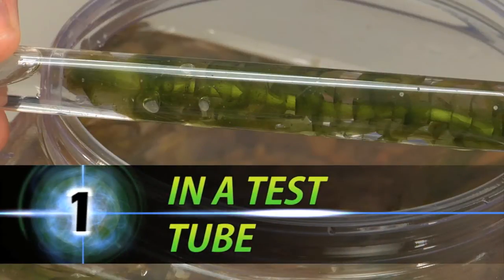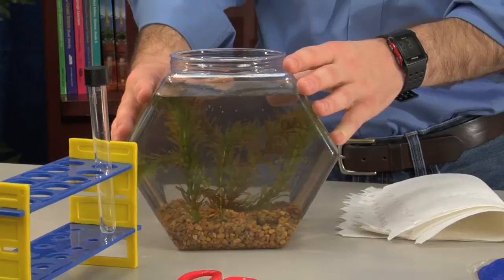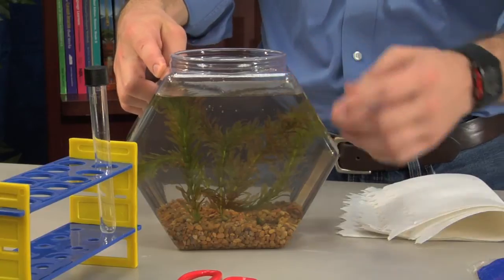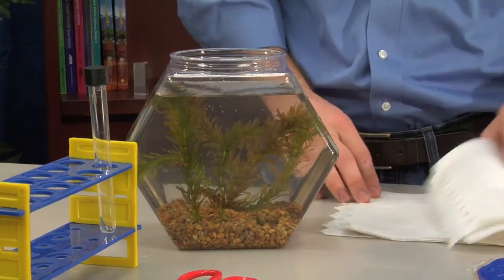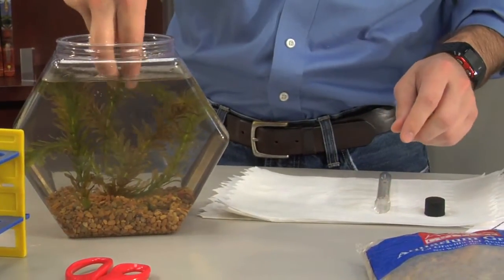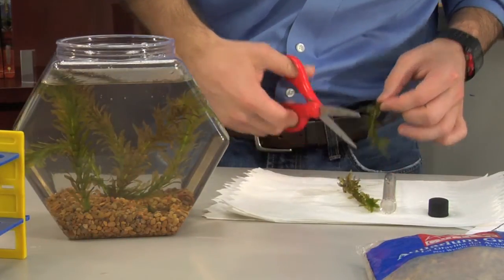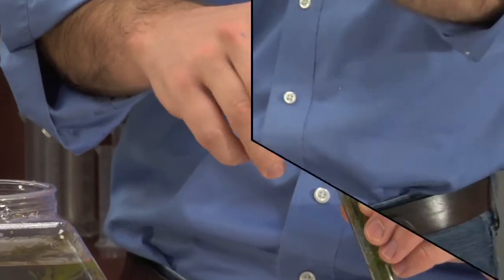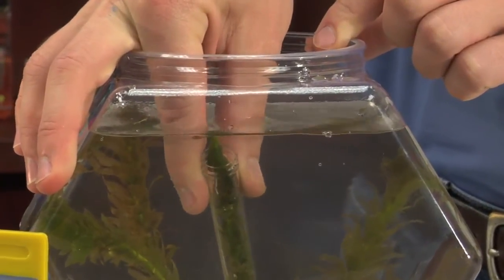Let's first explore photosynthesis in a test tube. Prepare the water container with enough tap water to submerge the plants and test tubes completely. Place rocks or gravel at the bottom to hold test tubes in place when submerged. Select one Elodea plant. If too long, use scissors to trim the root end of the branch. Insert the plant with the cut end last. Next, submerge the test tube and fill with water, avoiding any air bubbles.